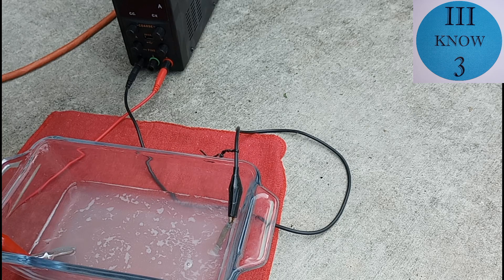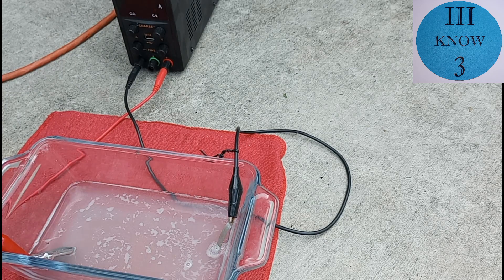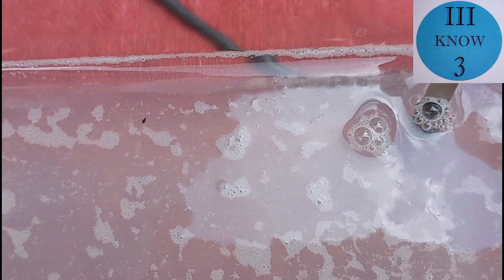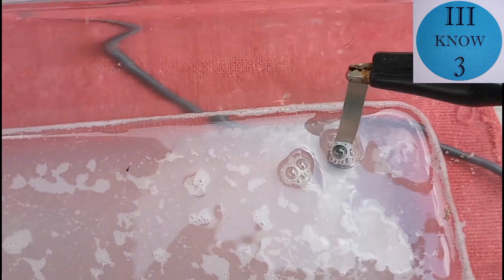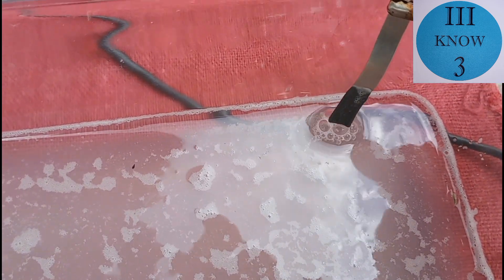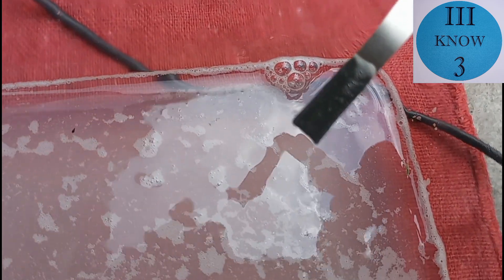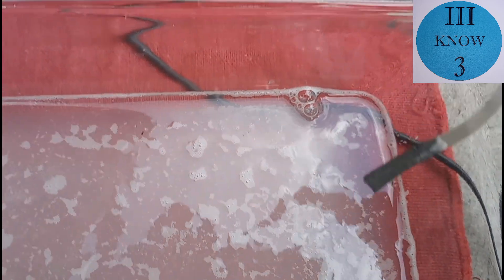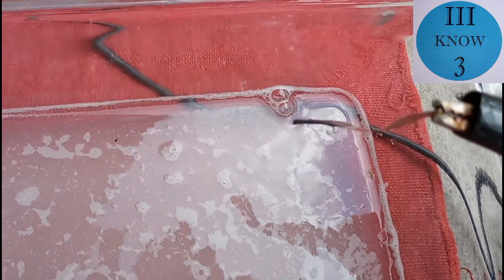And we'll turn the power on. So right away I noticed that there was a lot of bubbling, a lot of activity on the cathode and the nickel electrode. On the anode side, the most noticeable thing was that it changed from silvery color to a black color. Here I have the amperage turned way down, but I'm still not happy with the nickel strip. It looks like the hydrochloric acid is eating the nickel faster than the tin can plate out on it.